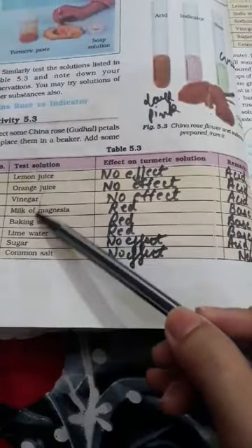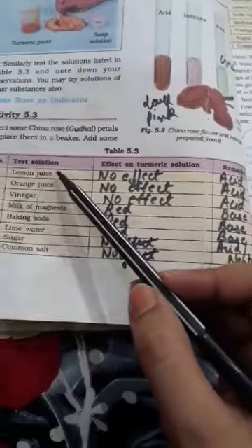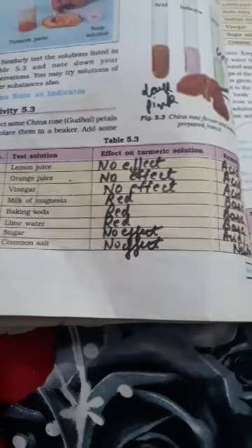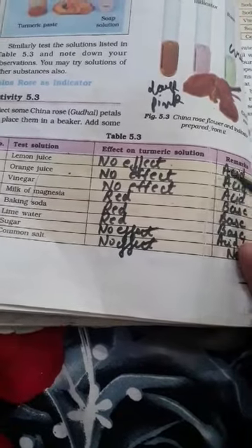Now let us come to table number 5.3, which is related to our turmeric indicator. We are given certain solutions. For the first three — lemon juice, orange juice, and vinegar — when we add turmeric solution to these, we will see no color change. Turmeric solution shows no color change with acids, so that means these three solutions are acidic.